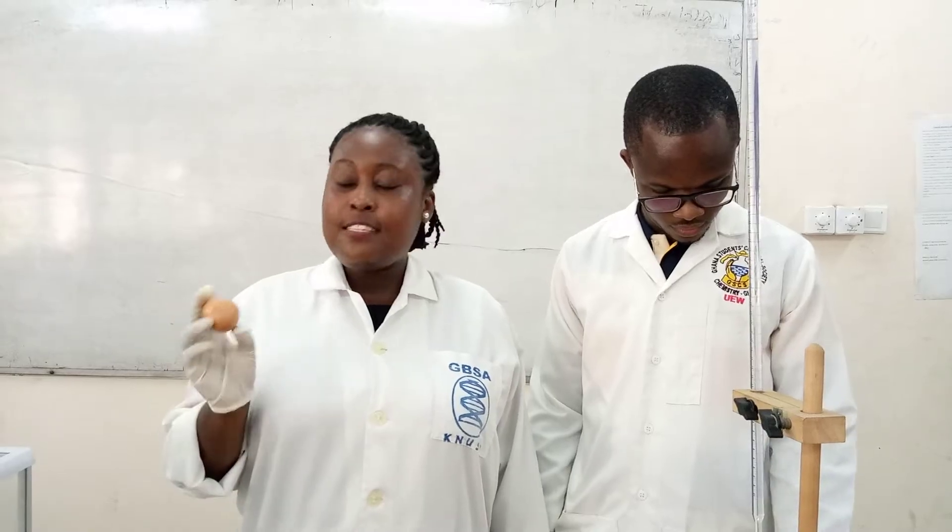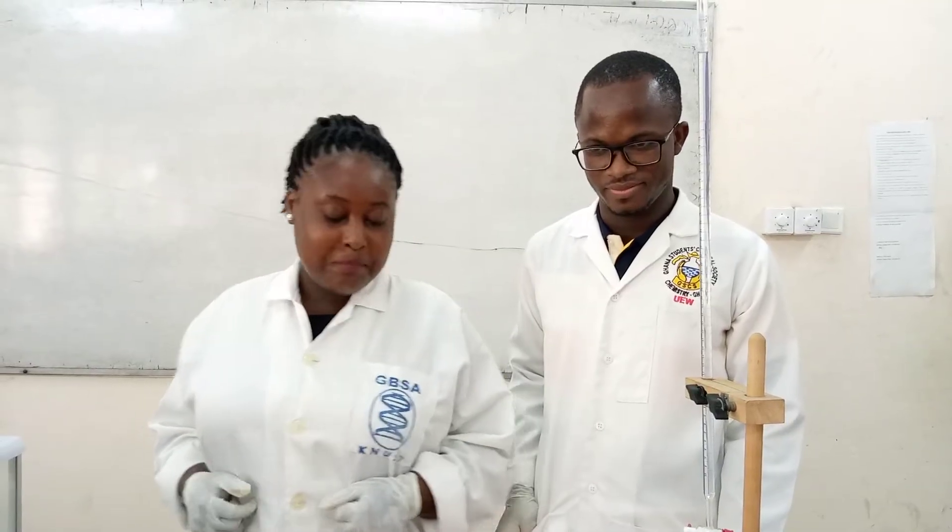I have here with me an uncooked eggshell, and we are going to determine the calcium carbonate in this eggshell. I'm not going to perform this practical — right next to me is my colleague, Isaac, and he is going to take us through today's practical. The title for today's activity is back titration, as my senior colleague rightly said.